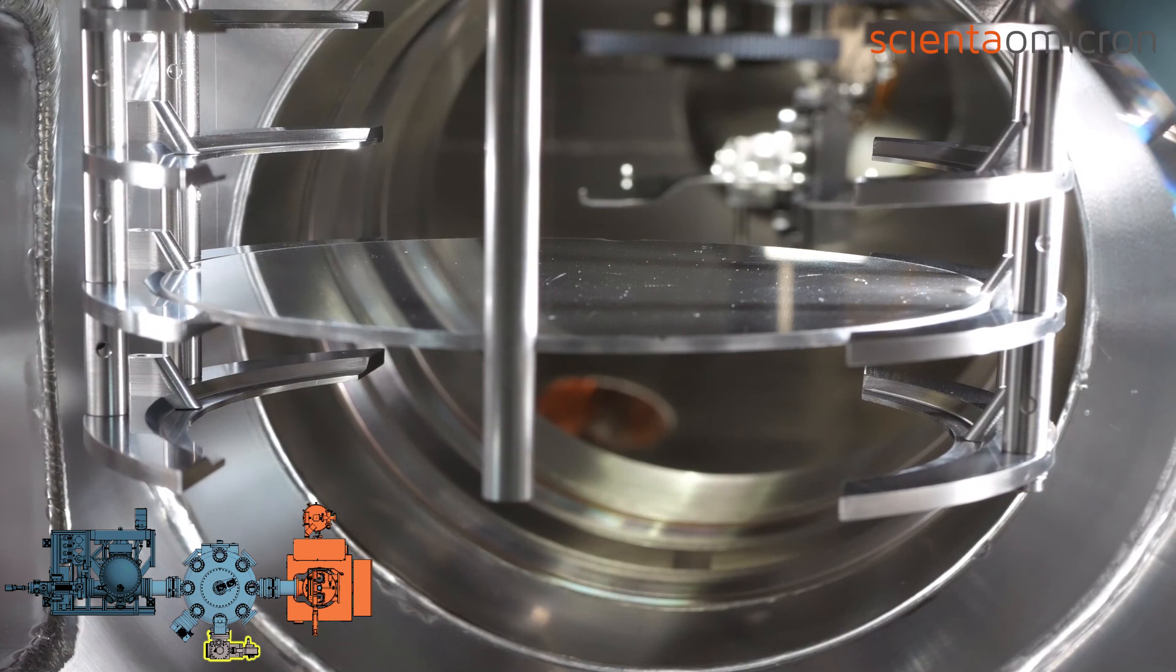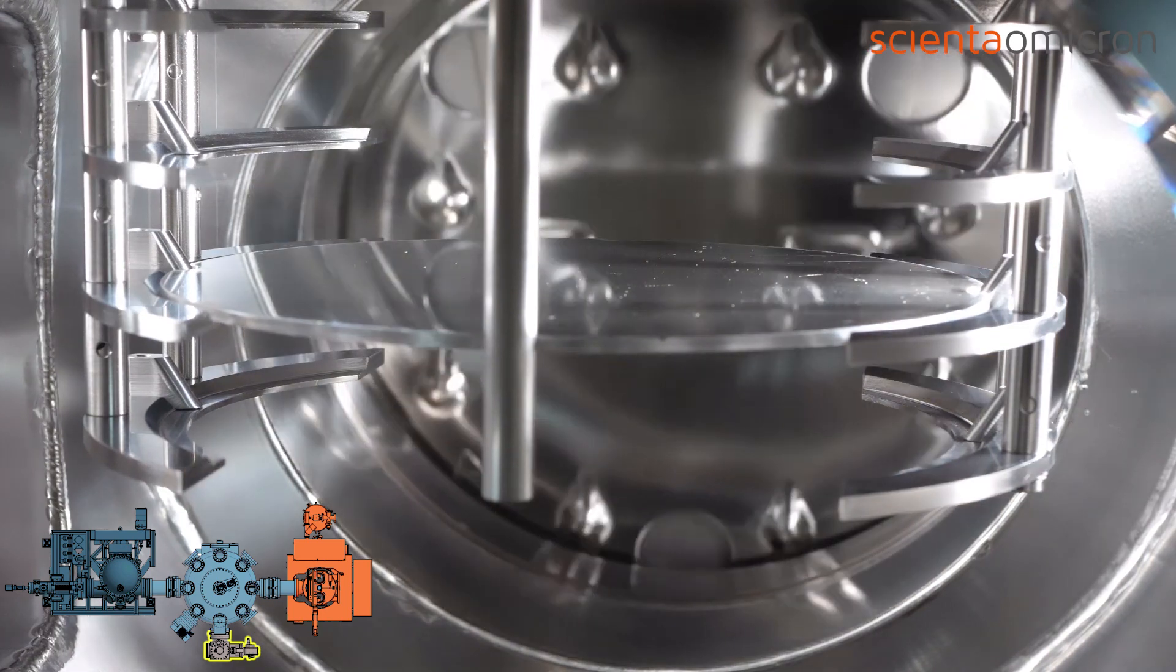When the arm is retracted, the UHV gate valve closes and with that, the loading procedure is complete.